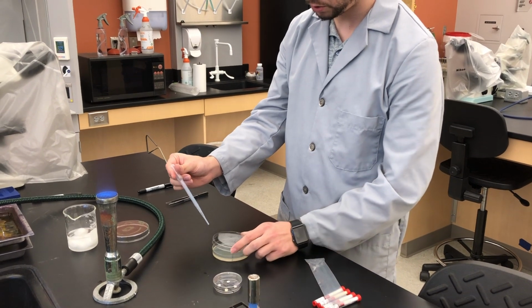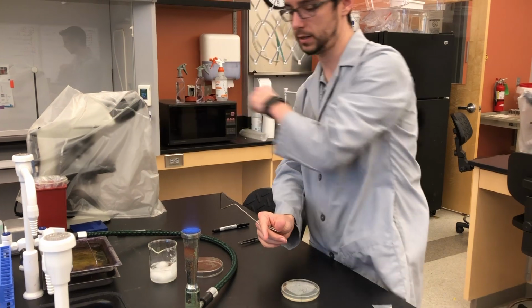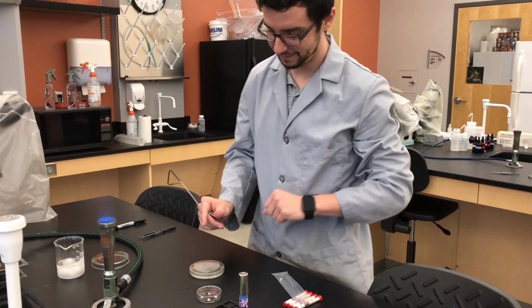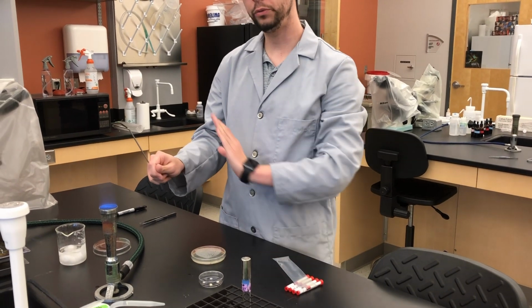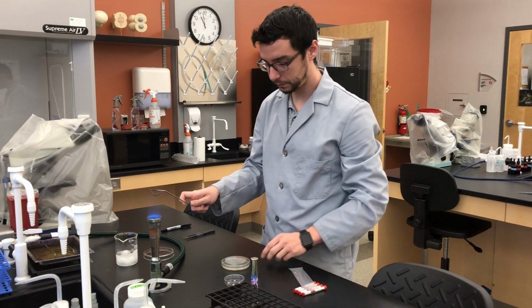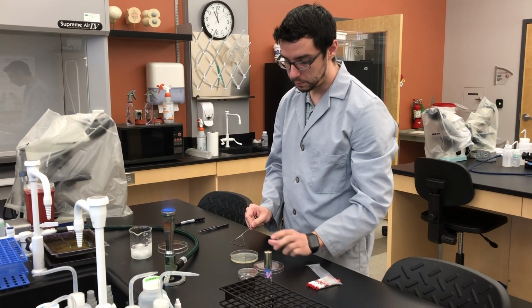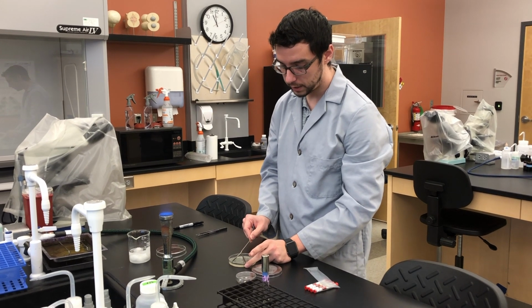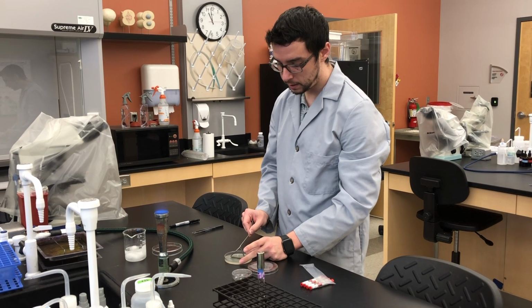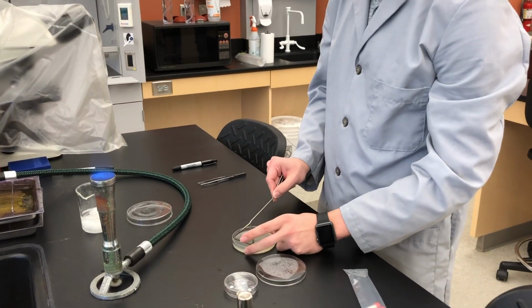Anything that you don't use, we will simply get rid of in our biohazard waste. Be careful moving your arm over, watch for that flame. Pay attention. At this point, hopefully this is cool, but if you're unsure, it's always better to wait longer. Again, before you touch your bacteria, it's always best to touch the edge of the agar first, and then bring that in to your bacteria before you start to spread it around.